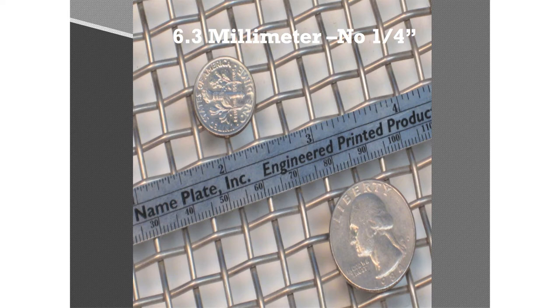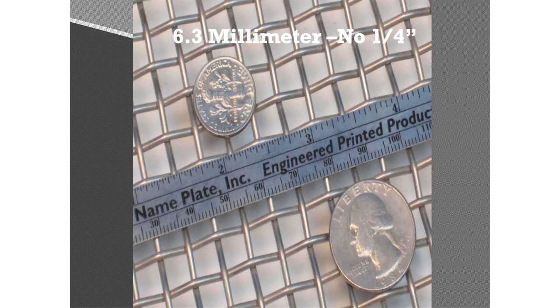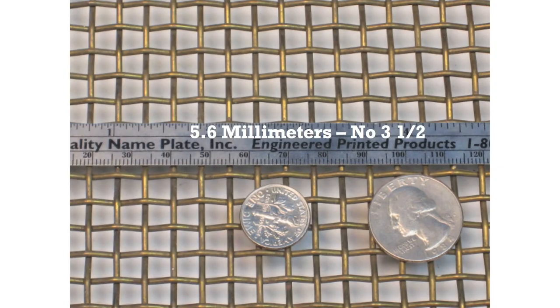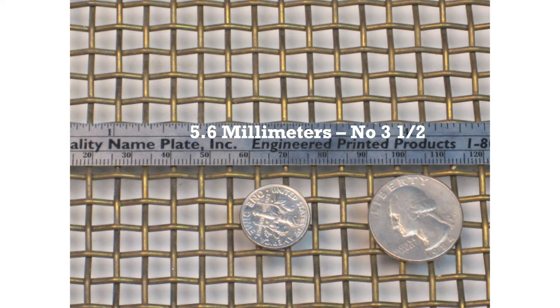When the hole sizes get smaller, the numbering convention changes to an alternate number starting at 3.5 for a 5.6-millimeter sieve, and ending with the number 635 for a 20-micron sieve. Yes, the number increases as the size decreases. By the way, a 20-micron sieve is at the limit of woven wire mesh potential.